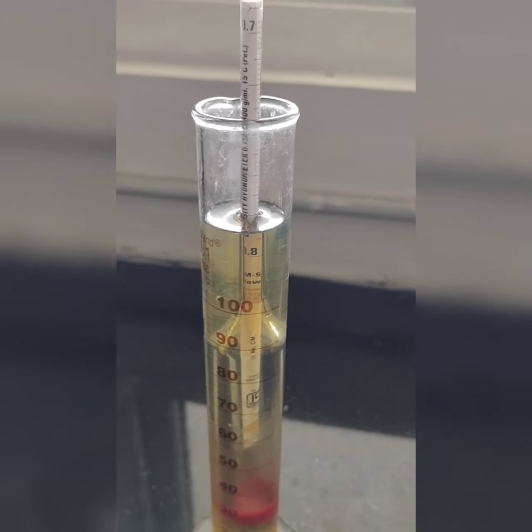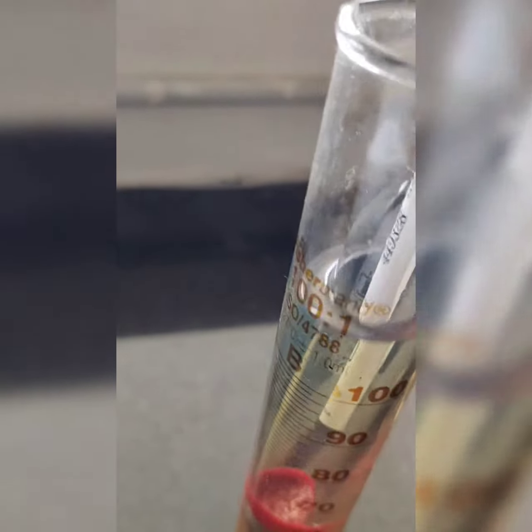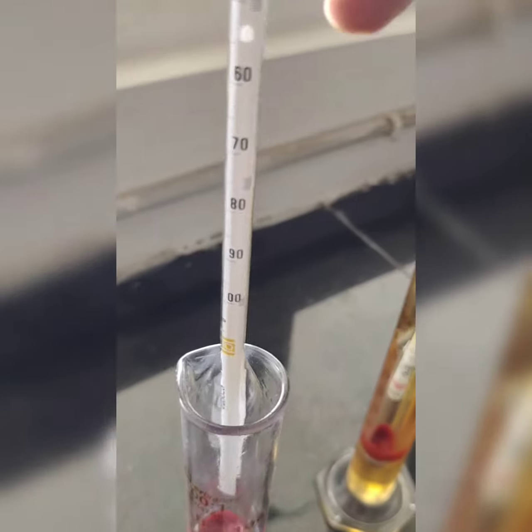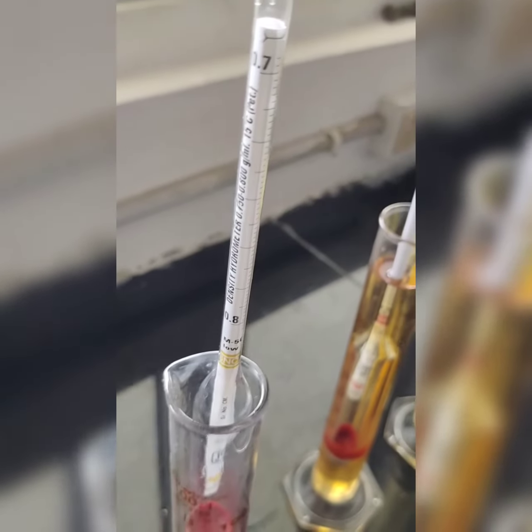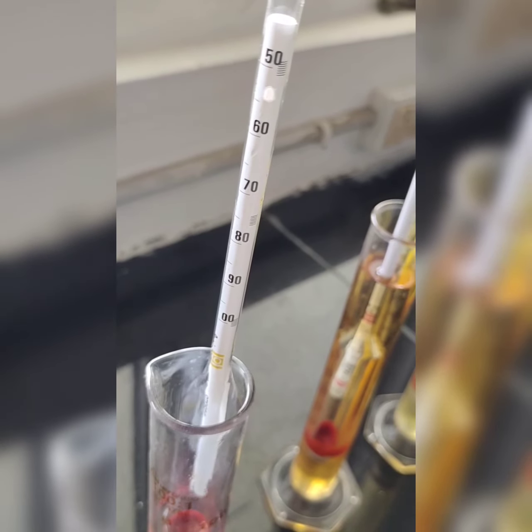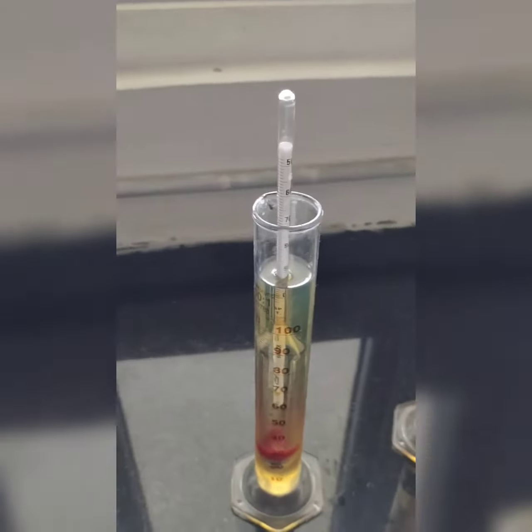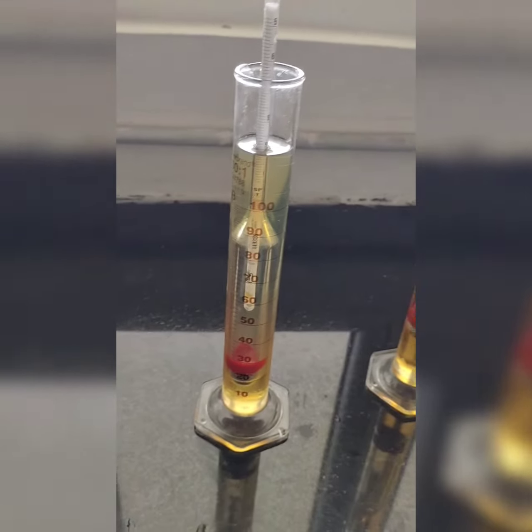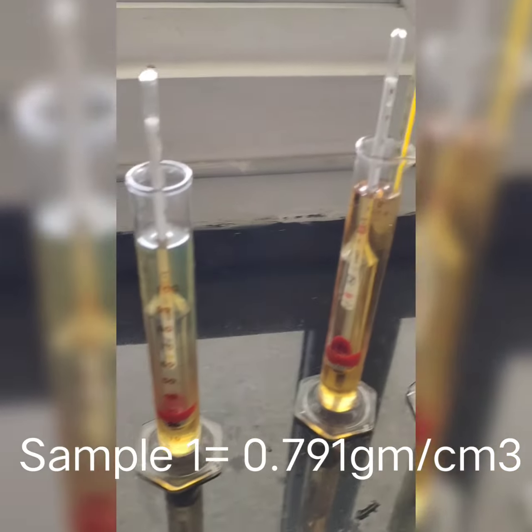That means it is from 700, right? 0.791. So the density of this one is 0.791, the liquid which is given here. So you can note it down, 0.791.